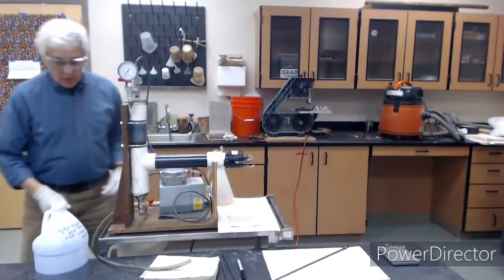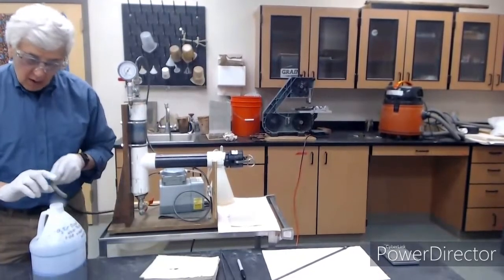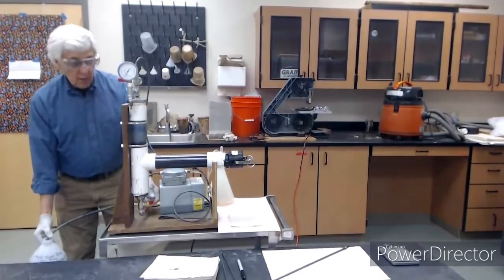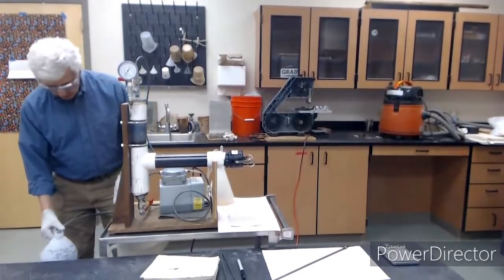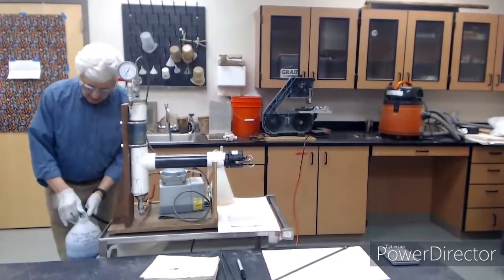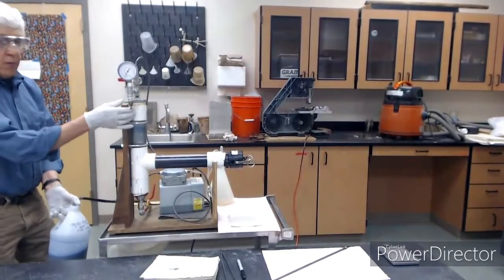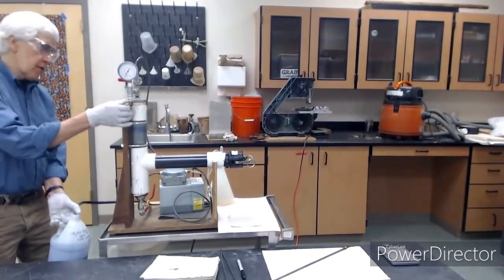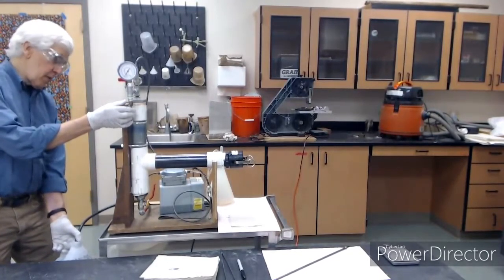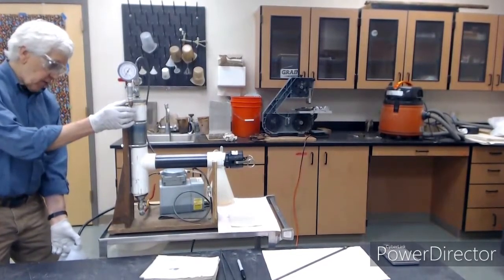All right. So now we drain the tank, put everything back in our storage tank. Not everything. To do that, we need to open this valve. I need to switch hands here. So we open this valve, and we open this valve to let some air in so everything can drain. I'm holding this lower than the cylinder, lower than the bottom valve, so things can drain.